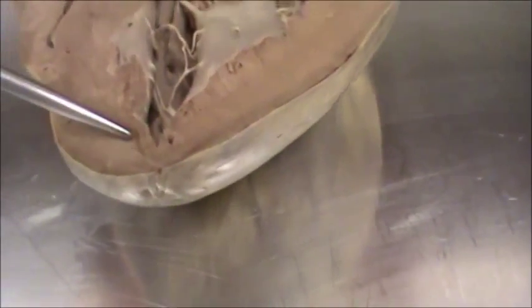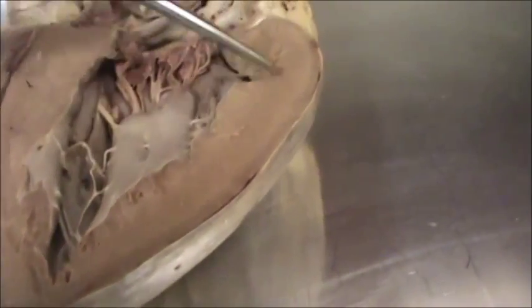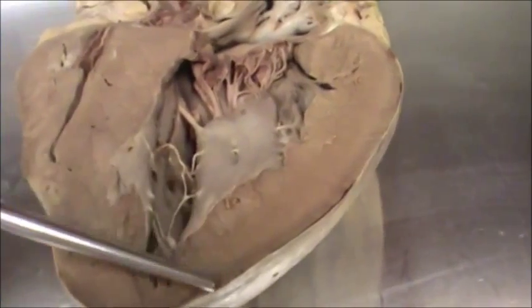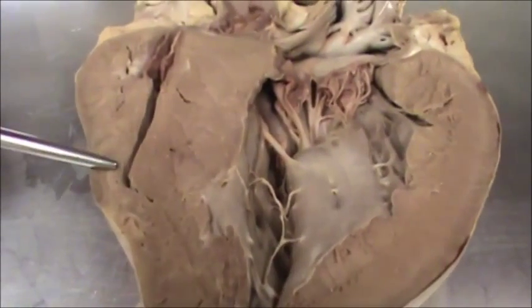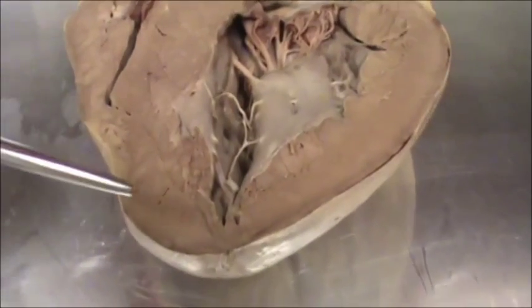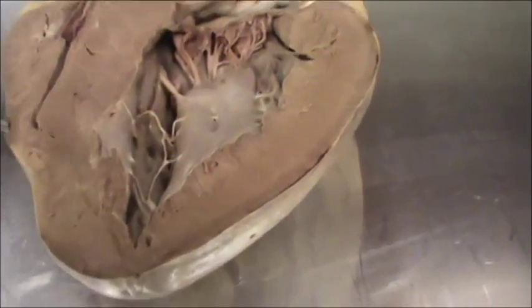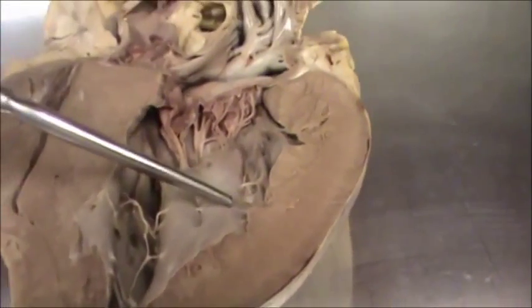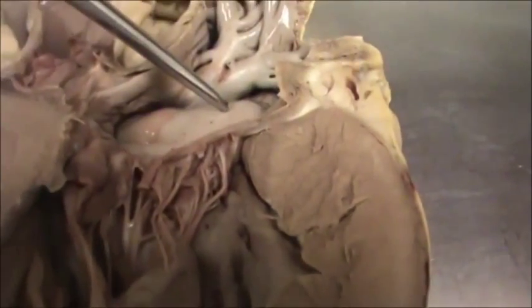The chamber starting from the apex is the left ventricle. You can also see the thick wall on the left side compared to the thin wall. So this is the left ventricle and this is the left atrium.